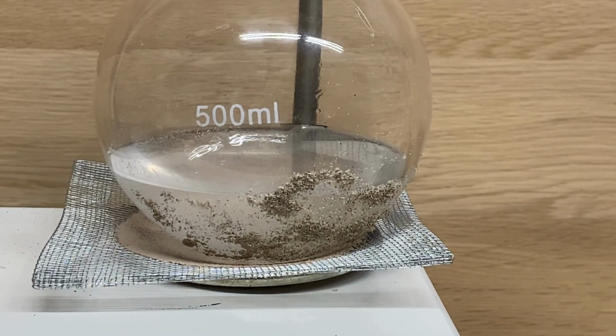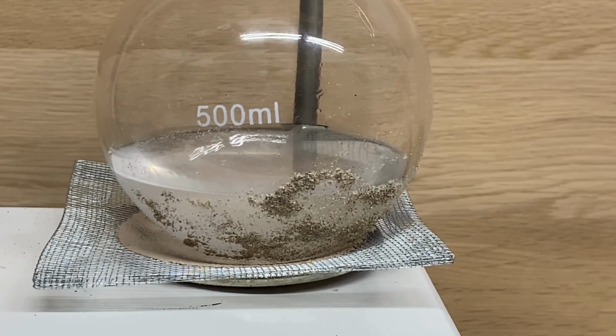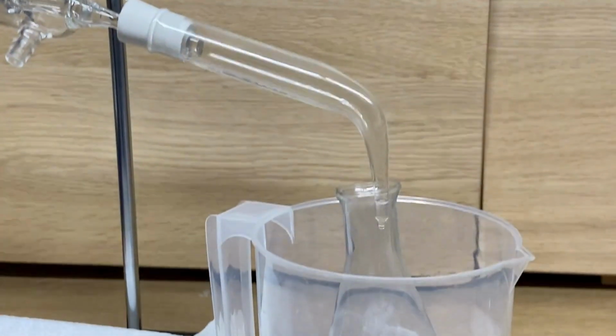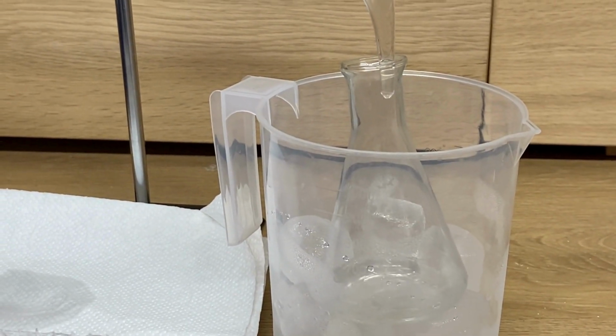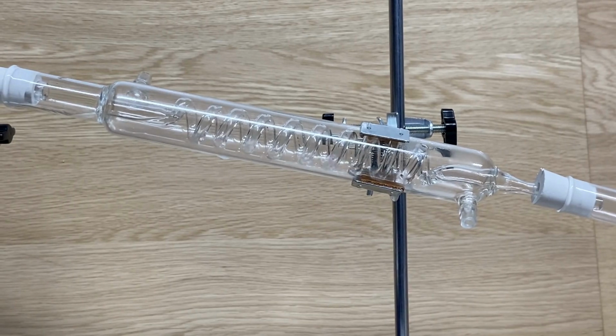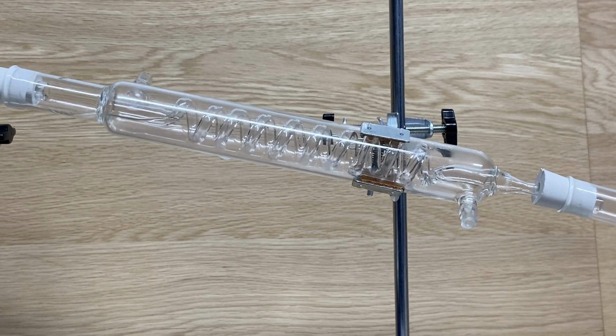You can see the alcohol is slowly starting to boil and vapor starts to rise from the boiling flask. At the other end, you can now see the alcohol dripping in the Erlenmeyer flask. We will need about 100 milliliters to be sure to make accurate measurements. While the alcohol is vaporizing from the mixture, you can see that the solution is getting less and less clear, indicating that what remains in the flask is, besides water, also something else, very likely some products to denature the alcohol. As you can see, the vapor that liquefies inside the condenser is also boiling. This creates a beautiful buzzing sound which I was not able to record properly.